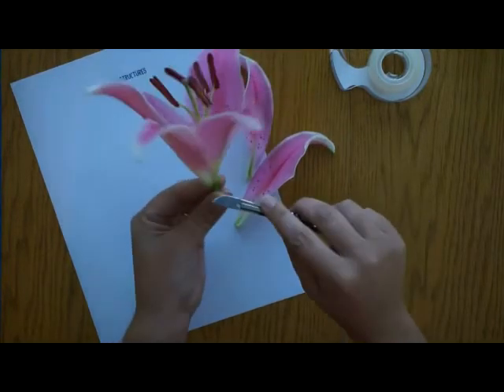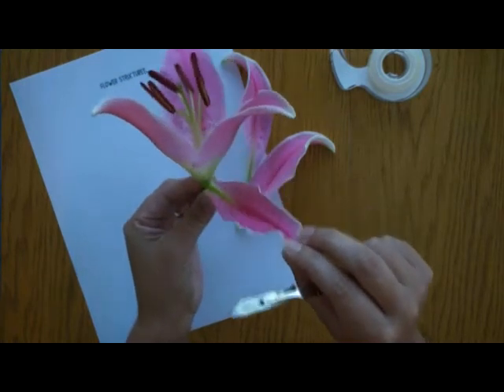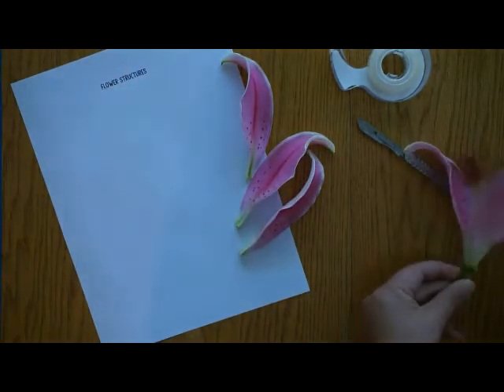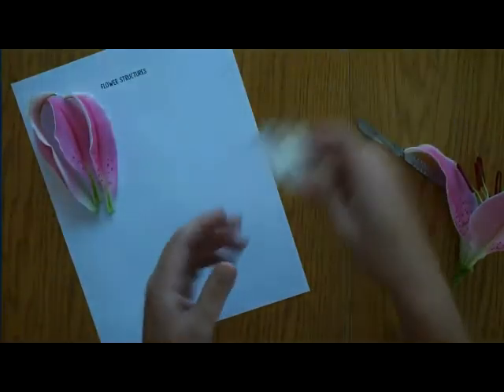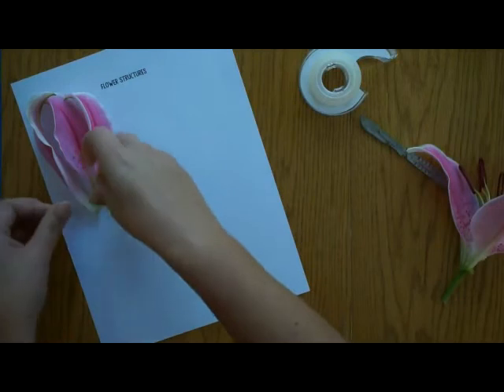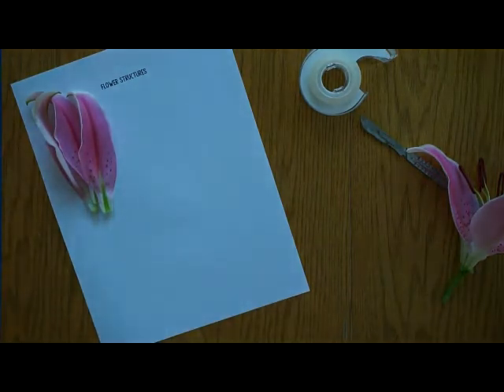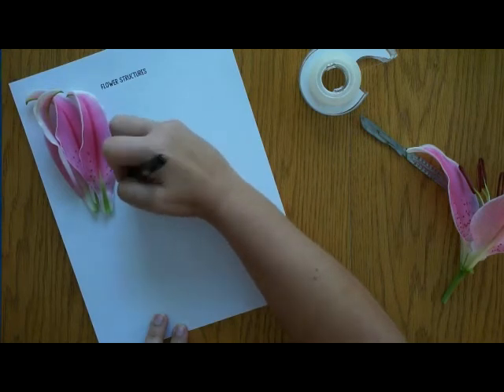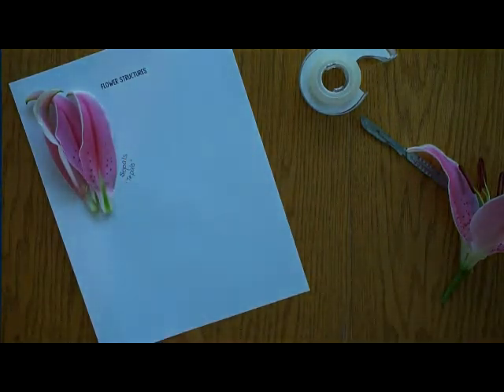If you're not using a lily, your sepals may actually be green. It's a little confusing to not have green sepals on our lily, but the lily has so many other structures that are big and easy to see that it made the most sense to use for the video. You're going to take your sepals and tape them down onto your flower structures page, then label them — I'm going to label these sepals or tepals because of our lily.